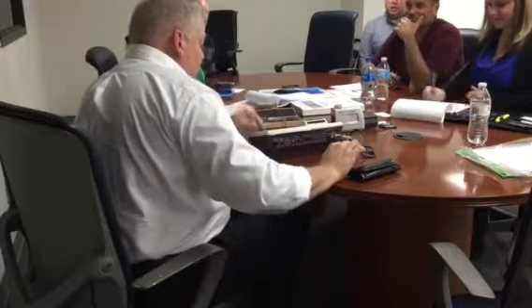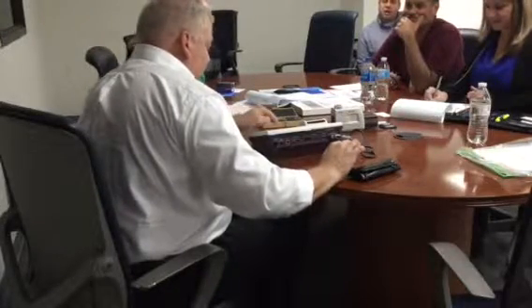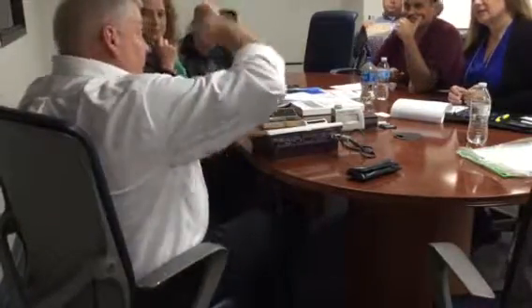But let's go into our conditions and turn on a different parameter. We'll turn on the Rt, which is total height of the profile. I should have probably hit recalculate. Ra, Rt, 400 microns. Rt is the total height, the highest peak to the lowest valley. Ultimately what we're going to be using here is not the R profile, we're going to use the Pt.